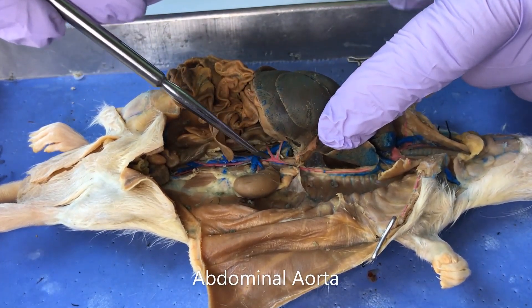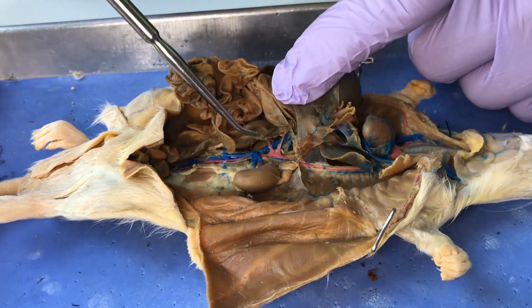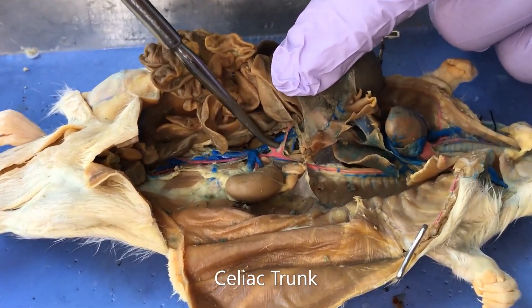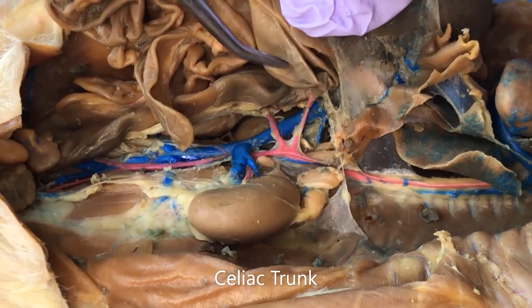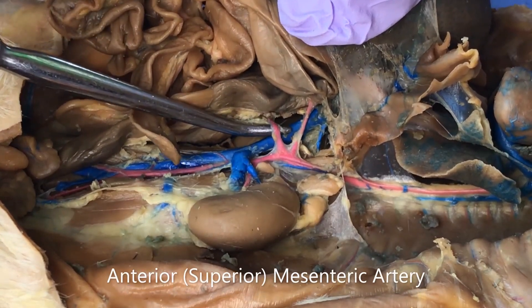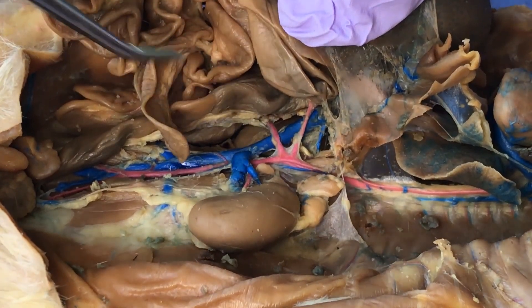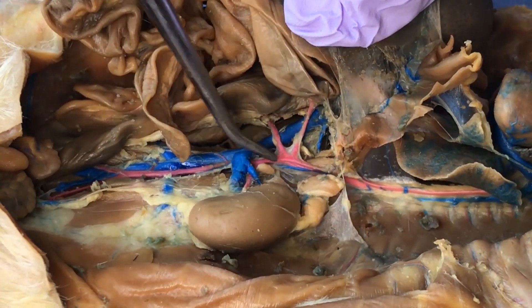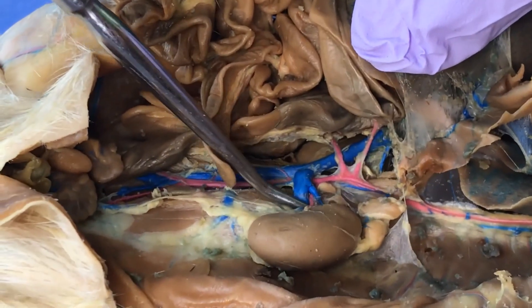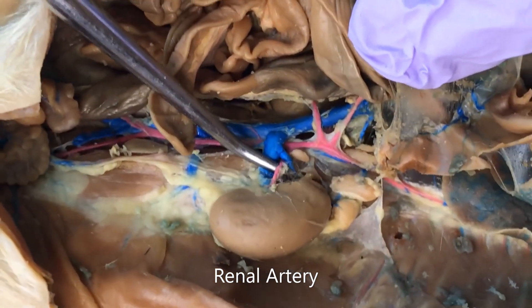Once it gets past the diaphragm it's the abdominal aorta. We can see blood vessels emerging in sequence here. The first is called the celiac trunk, which ultimately splits into a few other arteries — you don't have to know those on the rat. Then there's the superior mesenteric artery, which supplies a lot of the mesentery of the small intestine. The next to branch off is the renal artery — you can see this little red blood vessel right here — which supplies the kidneys.